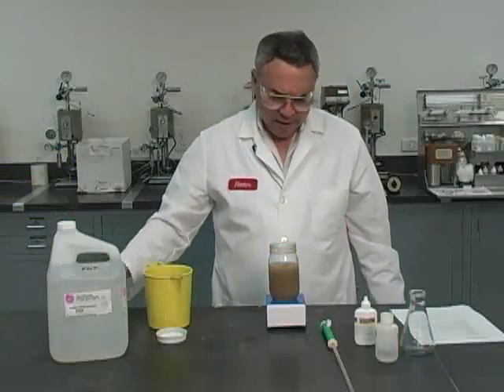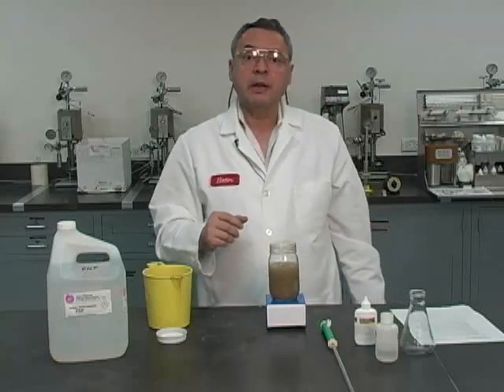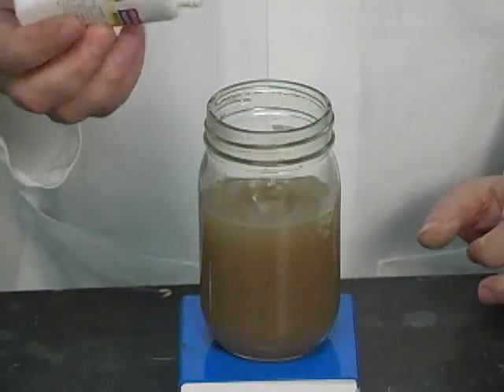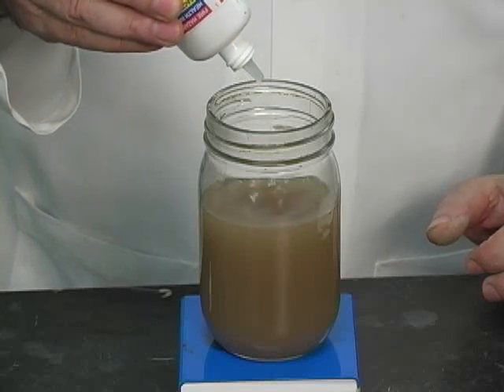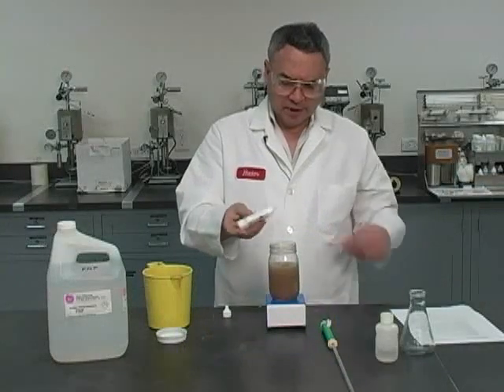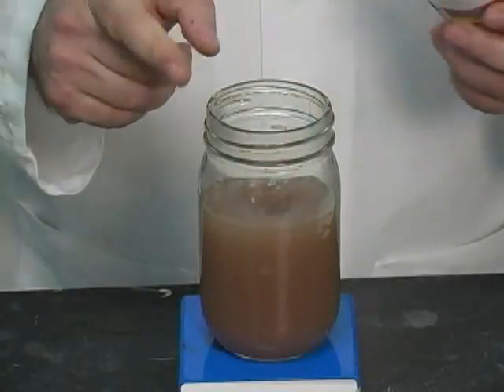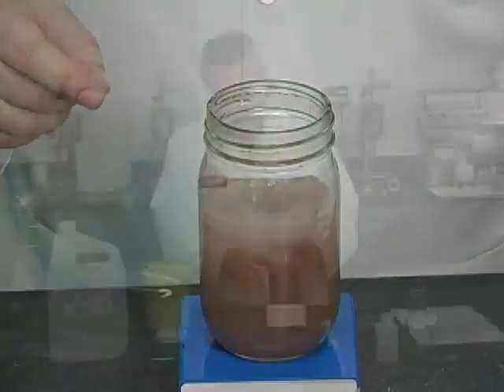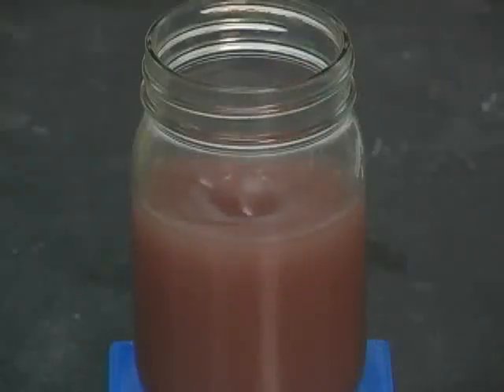Stirrer is working fine. So the next step is to put some phenolphthalein. We are going to add, as a matter of fact, 15 drops. And we will have to neutralize this. So that's the reason we are using this color indicator. That's 15. Now a pink color will show. It's already showing very clearly. This is turning reddish, but I don't have any problem seeing that this is pink.